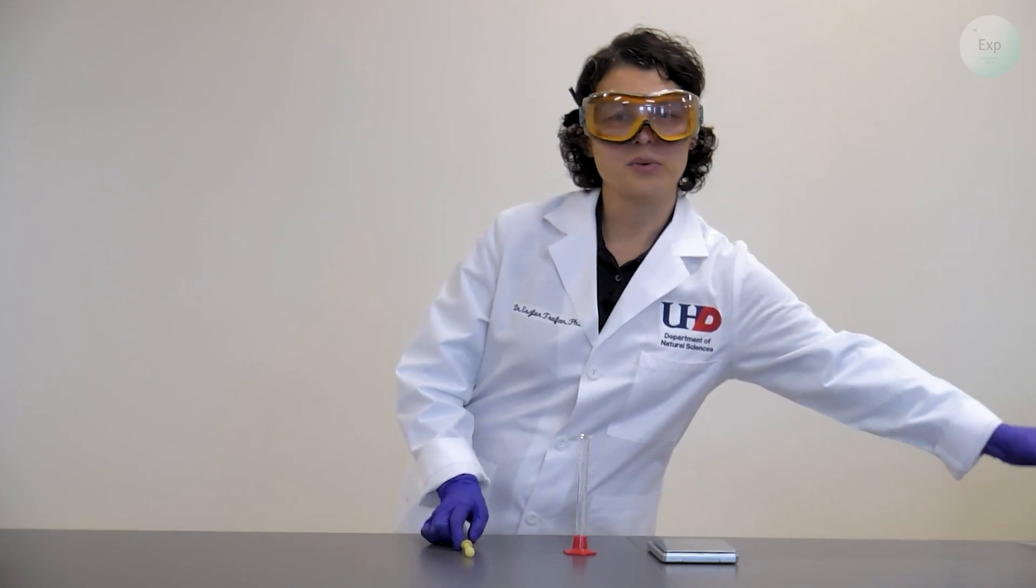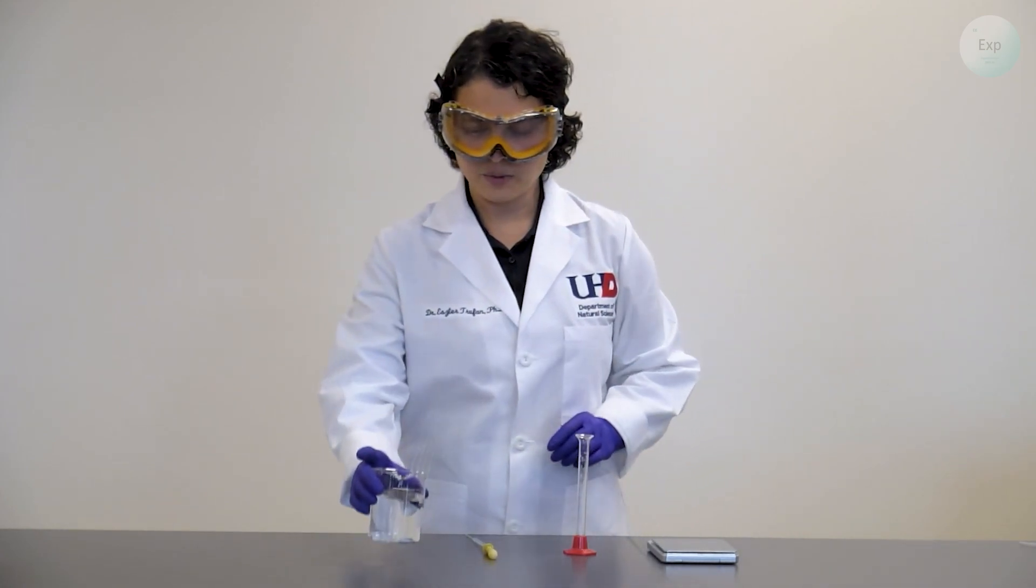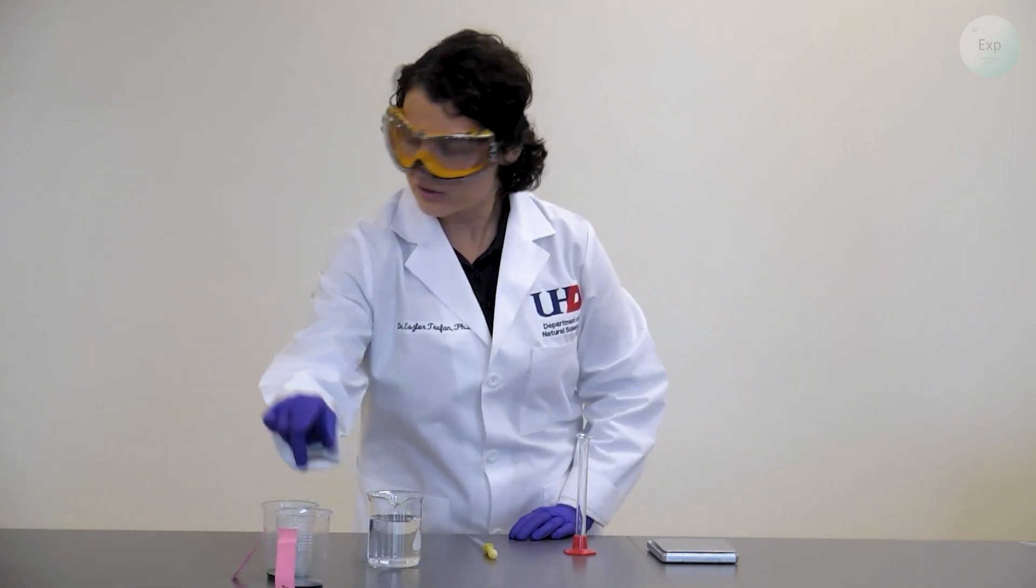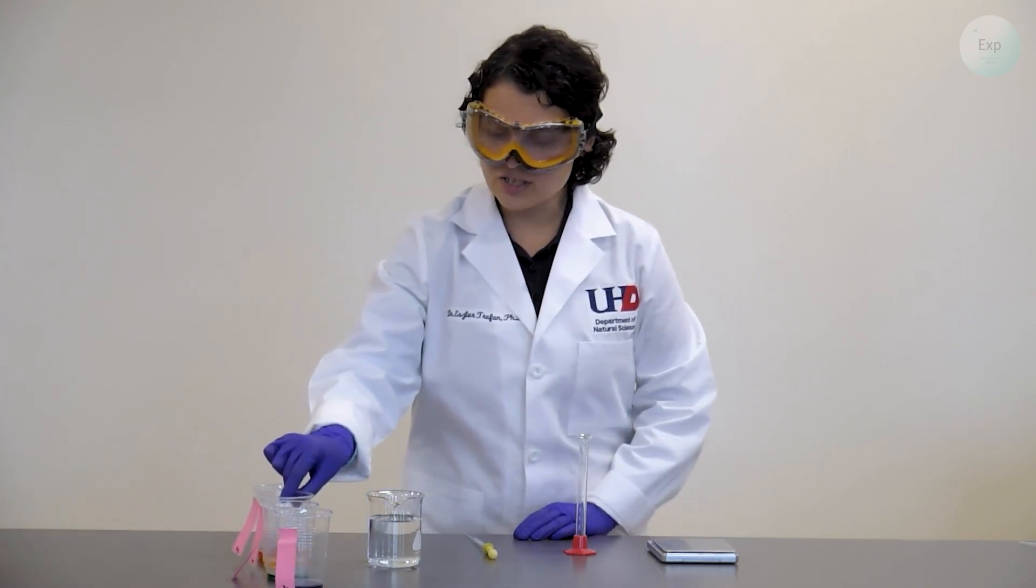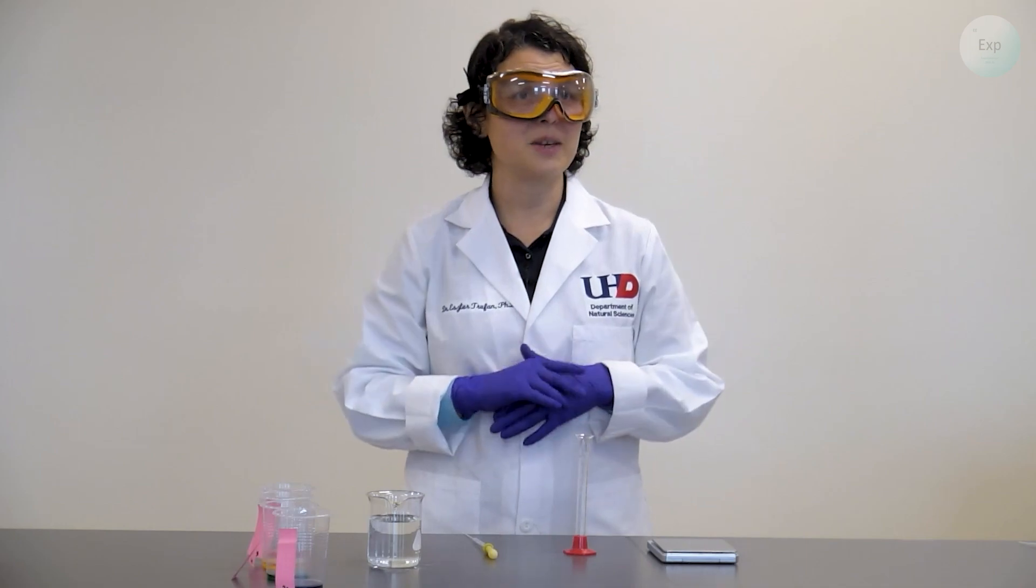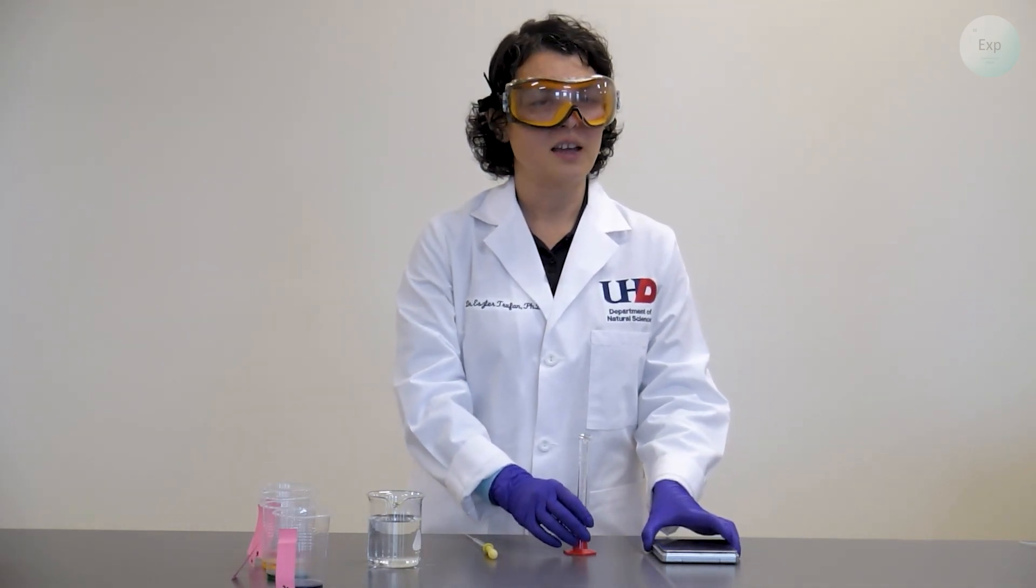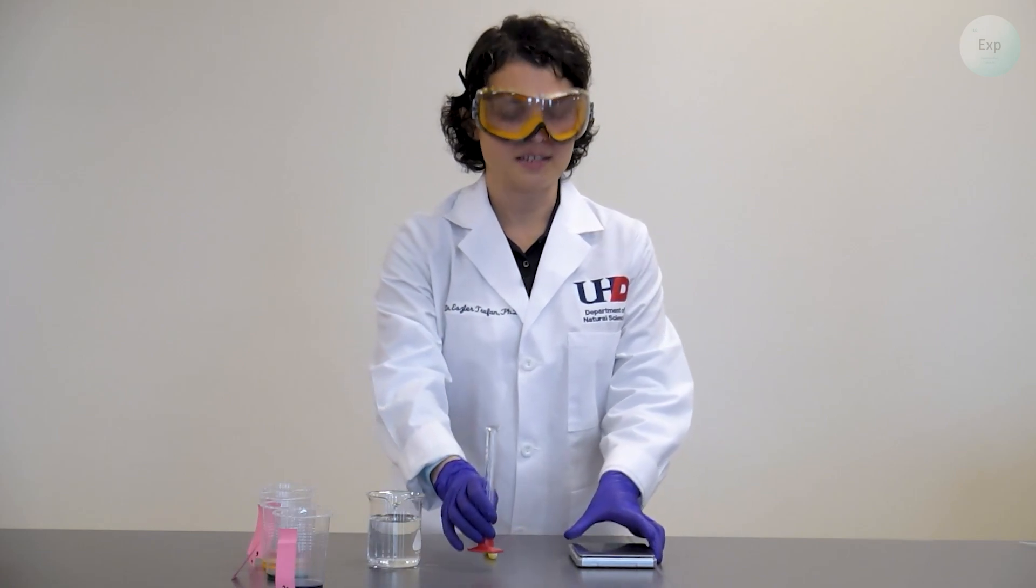Next, we're going to bring in our materials. We're going to use some water first, and then we're going to use our four solutions. For each experiment, we're going to perform the same exact process. I will demonstrate on the first, and then you will repeat all the others the same exactly.